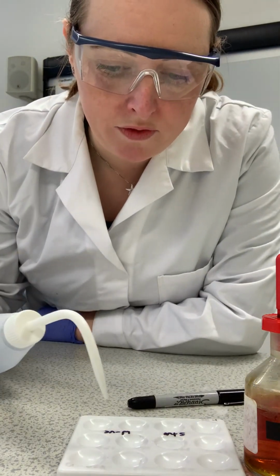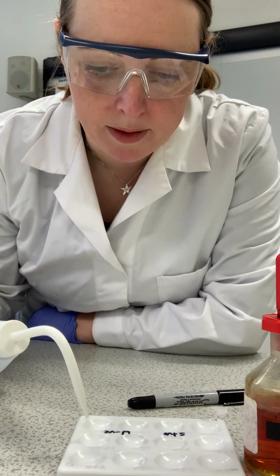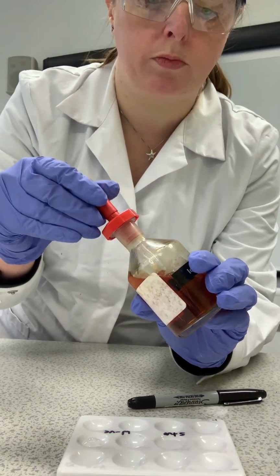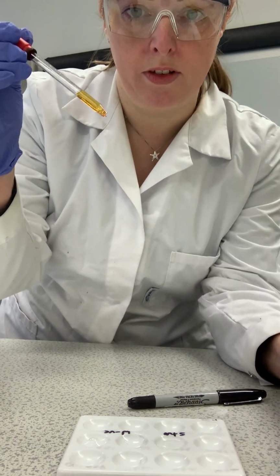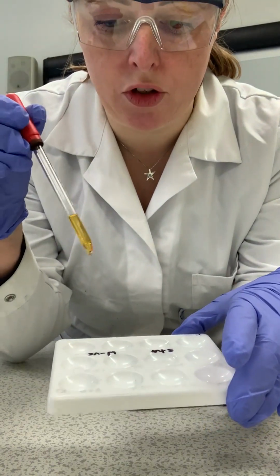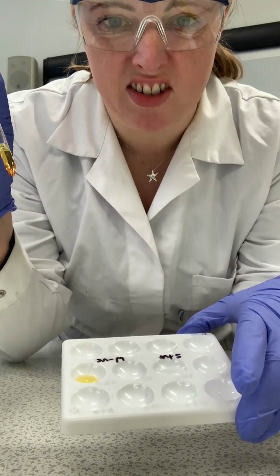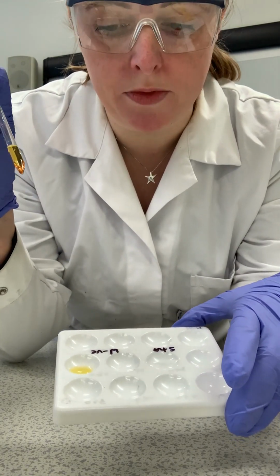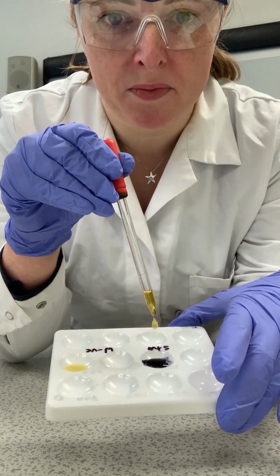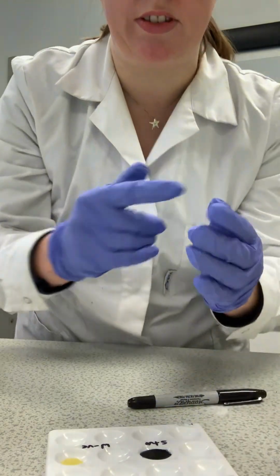Now, we've just got a small amount of the solution to be tested in there. And all we do with the starch test using a dropper bottle is take some of the solution, and you can see this here, and add a few drops. So if I add to the negative first, hopefully you can see it's just a yellow colour, nothing very exciting. Add it to the known positive, we've got that dark blue colour that tells us it's a positive result.